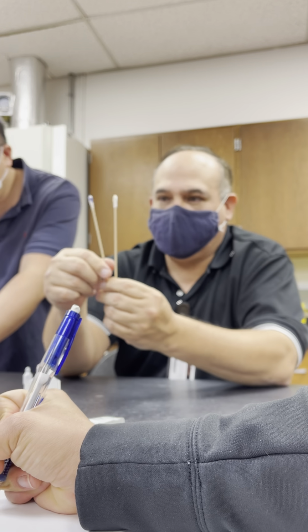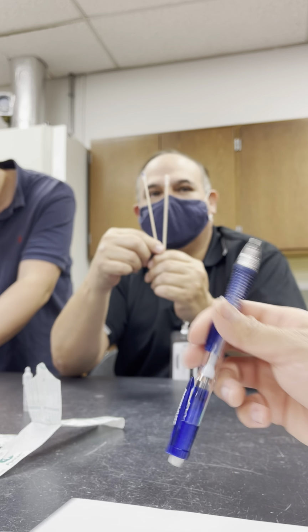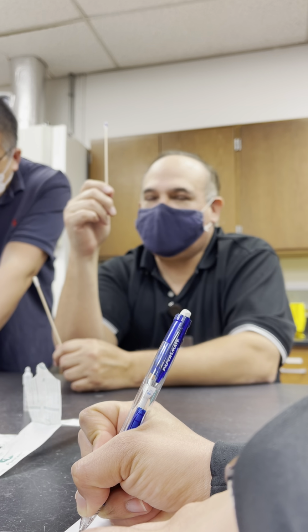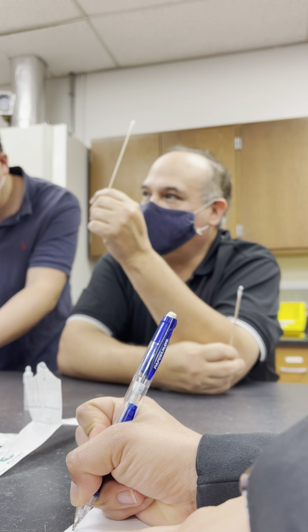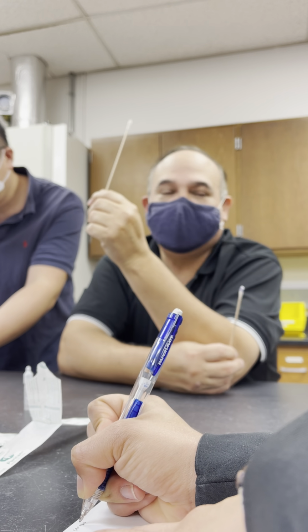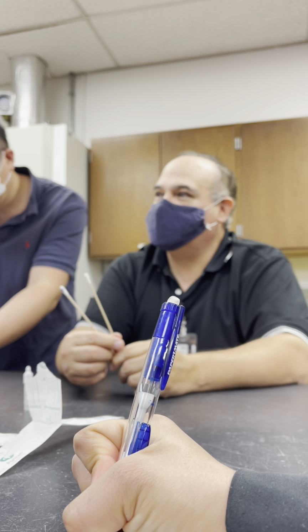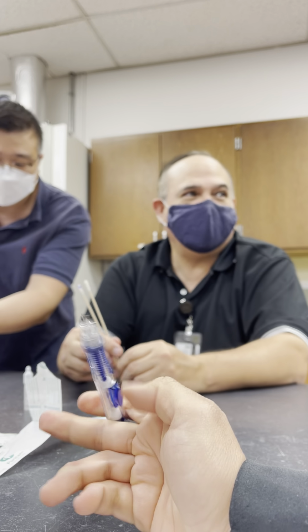Okay? But you can see the difference in the test, right? So is this particular organism positive, negative? Positive. Is it enteric, non-enteric? No. Is it aerobic or facultatively anaerobic? Very good. Enteric, non-enteric? Enteric. Okay? Is it facultatively anaerobic or aerobic? See the kinds of questions? That's like 6 questions for the practical right there.